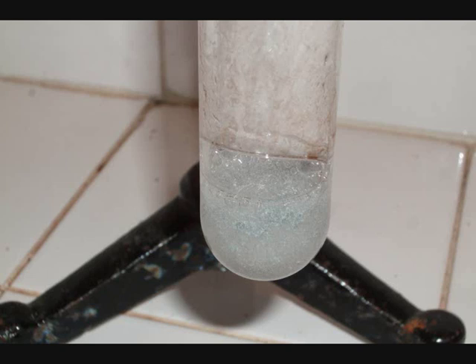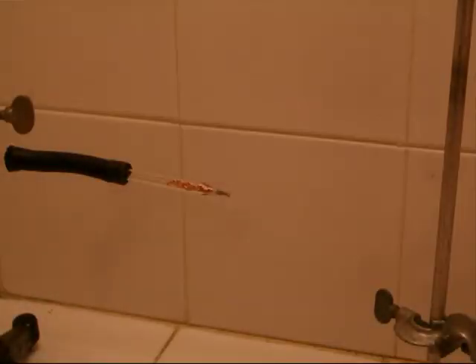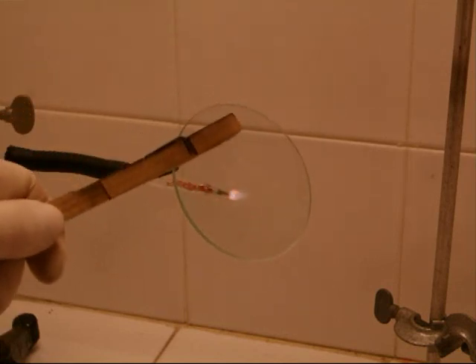In the reaction of zinc with hydrochloric acid, nascent hydrogen is produced. This nascent hydrogen quickly reacts with the arsenic compound to form arsine. This arsine bubbles with the hydrogen through the piping into the pipette. This arsine-hydrogen mixture is highly flammable and is ignited at the end of the pipette. The arsine decomposes in the heat to arsenic, so pure arsenic can be condensed out of the flame.